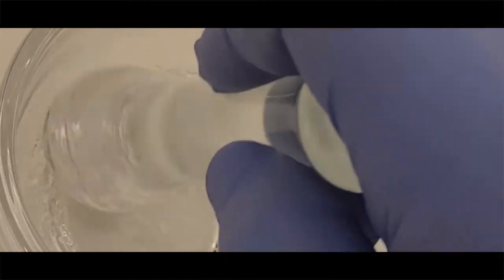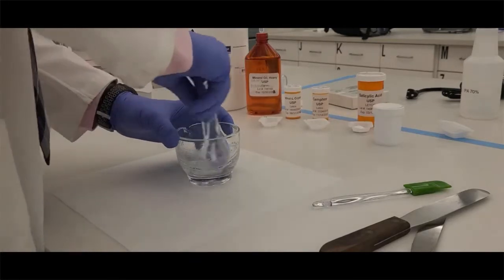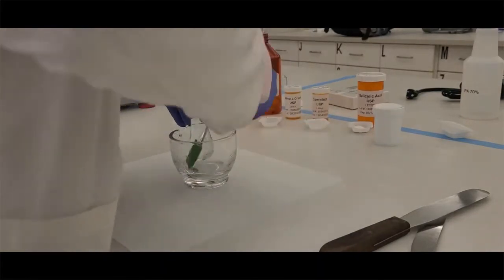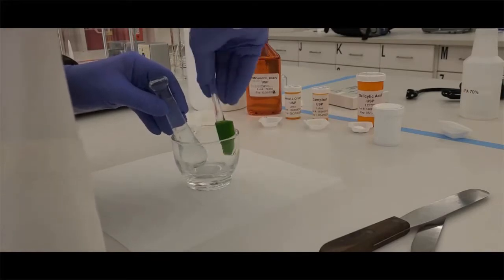Now this isn't quite yet ready, but as I keep triturating it, you will start to see more of those solid materials start to turn into the eutectic mixture. So here I'm just speeding it up for us, but trying to get the edges off and make sure that there's no particles that are not incorporated into the eutectic. Everything is a liquefied mass.